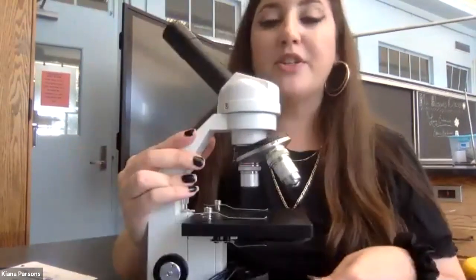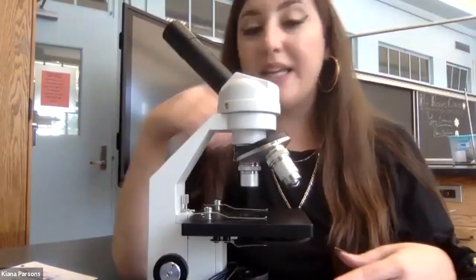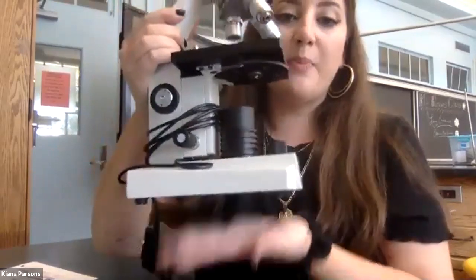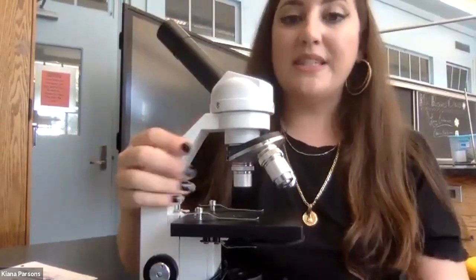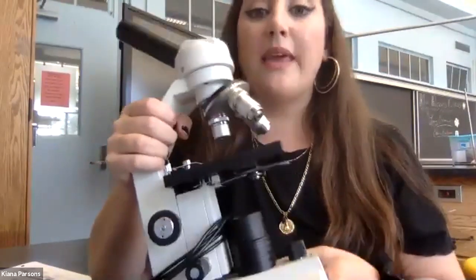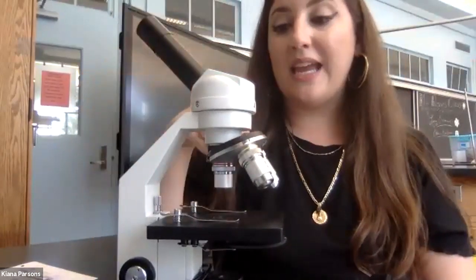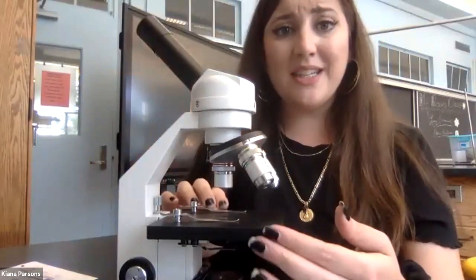But this microscope isn't that high-powered because it only has the eyepiece and the revolving objectives to create your level of zoom. So we already started talking about the different parts of the microscope. So I'm going to go through them with the actual microscope, and then we're going to complete the matching on the handout. So down here we have our base that supports the entire microscope. That's what it stands on. This piece here that I keep holding the microscope by is the arm. The arm is how you carry the microscope, and the arm also holds the eyepiece and the revolving nose piece above the stage.